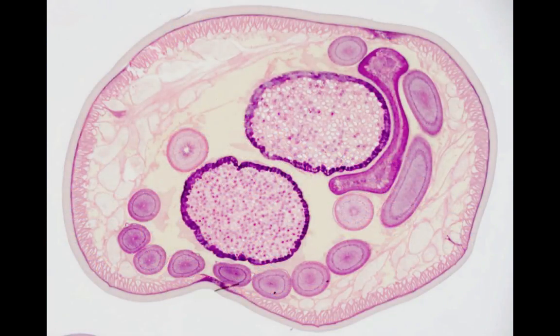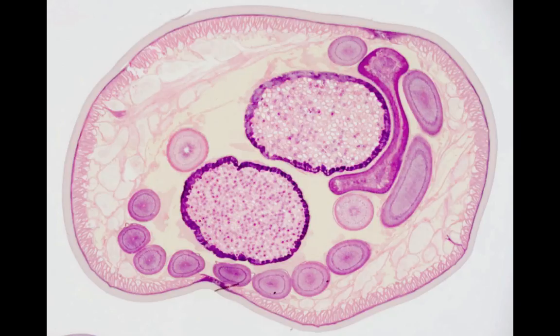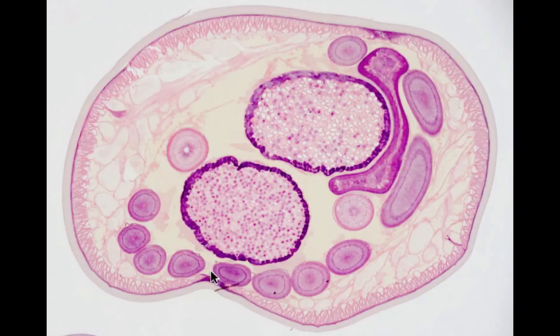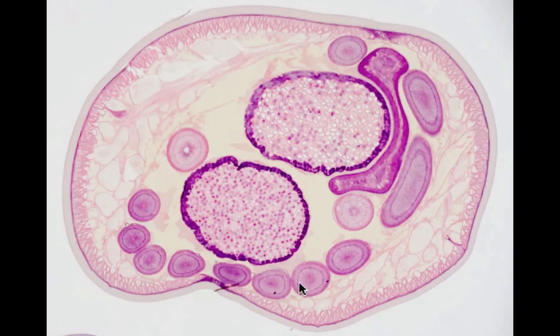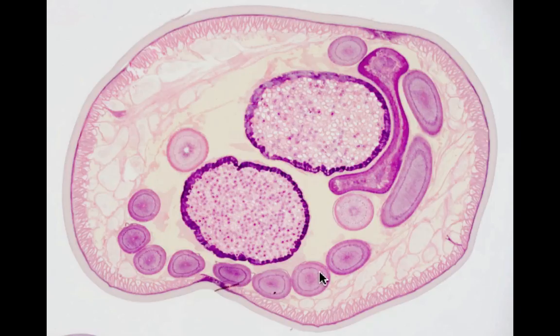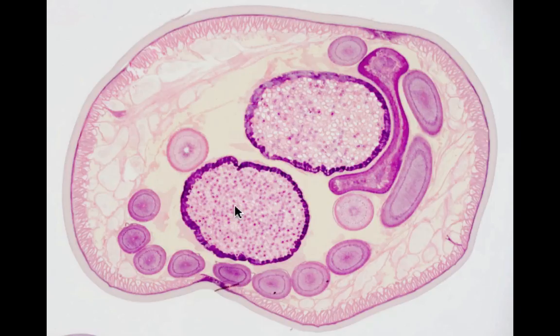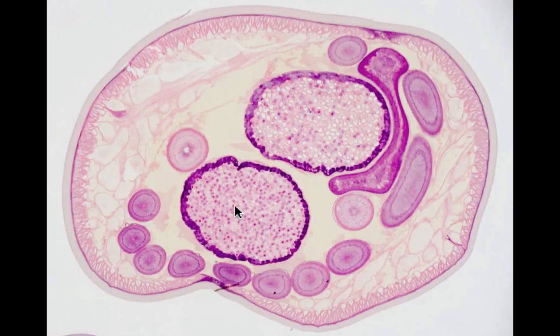Here we have a cross-section of a different female Ascaris. Sections of the oviduct are visible along the bottom. You can also see sections of the two uteri, with the contents plainly visible. Let's take a closer look at these.